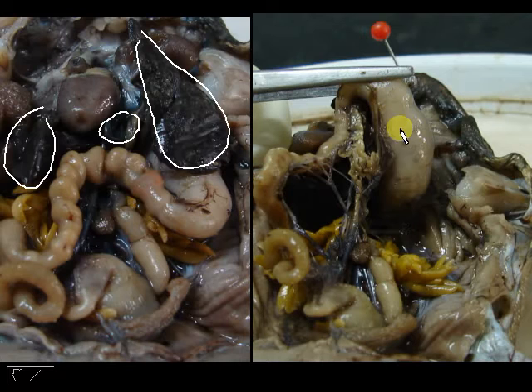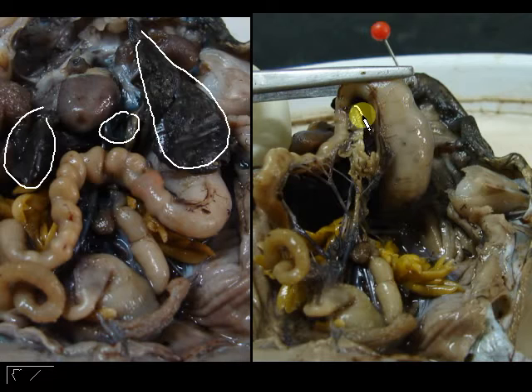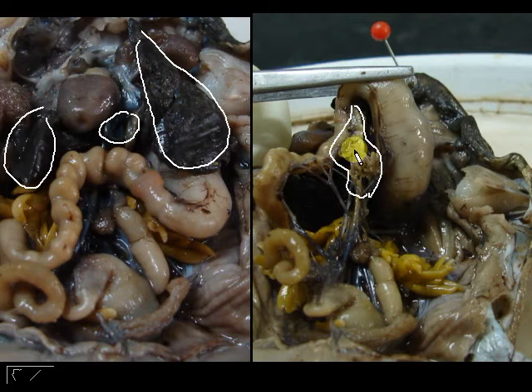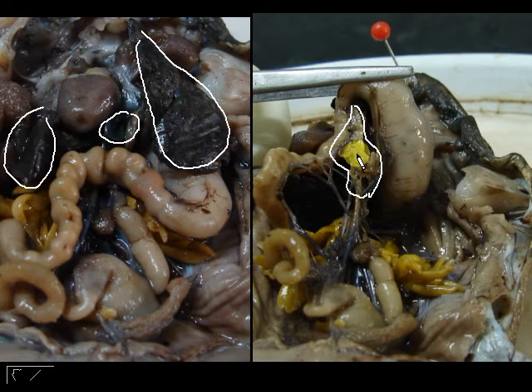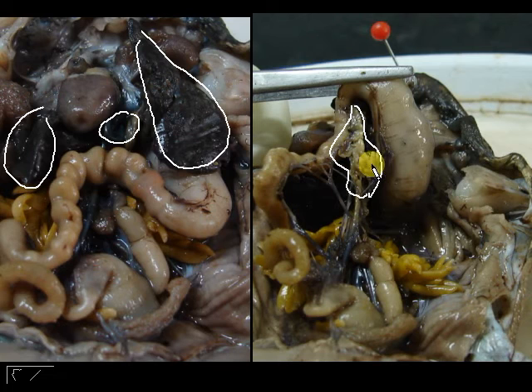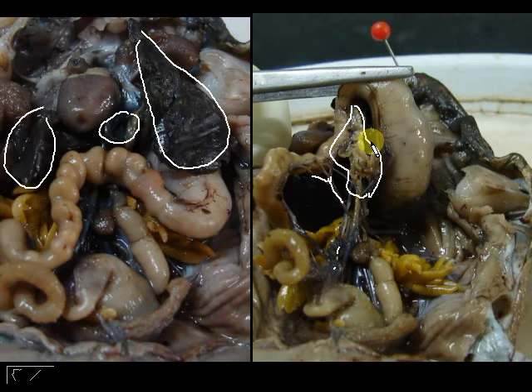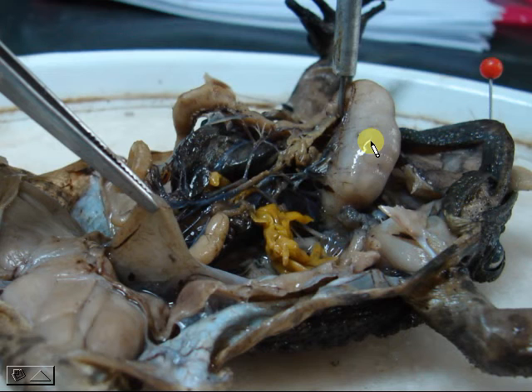If you flip the stomach upwards, past the stomach and small intestine, you will see a yellow substance attached to it. It looks like fat, but actually it is your pancreas. The pancreas secretes insulin and glucagon — different hormones involved in sugar metabolism. Those other parts are the blood vessels. So those are basically the accessory glands involved in digestion.